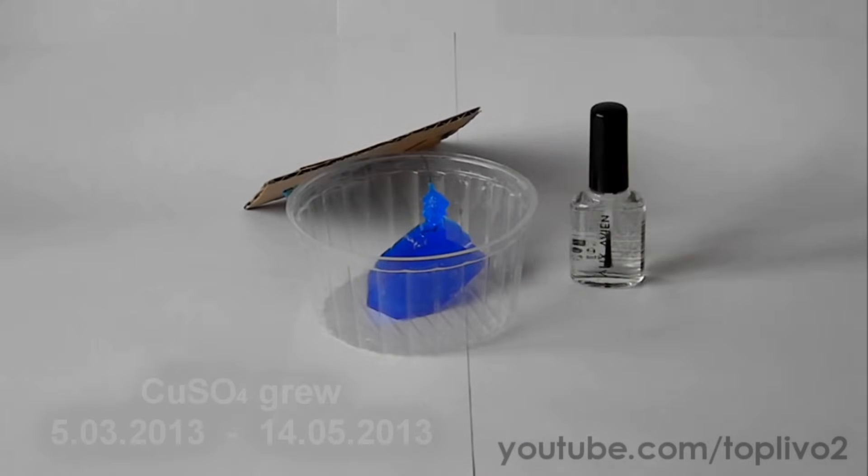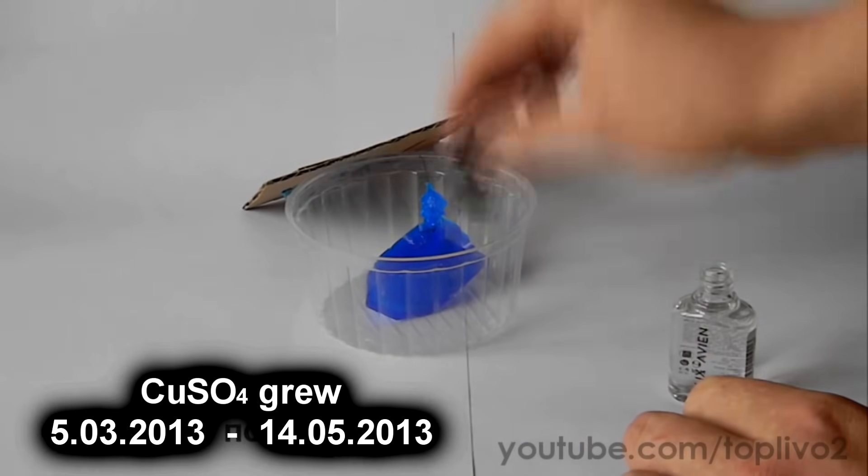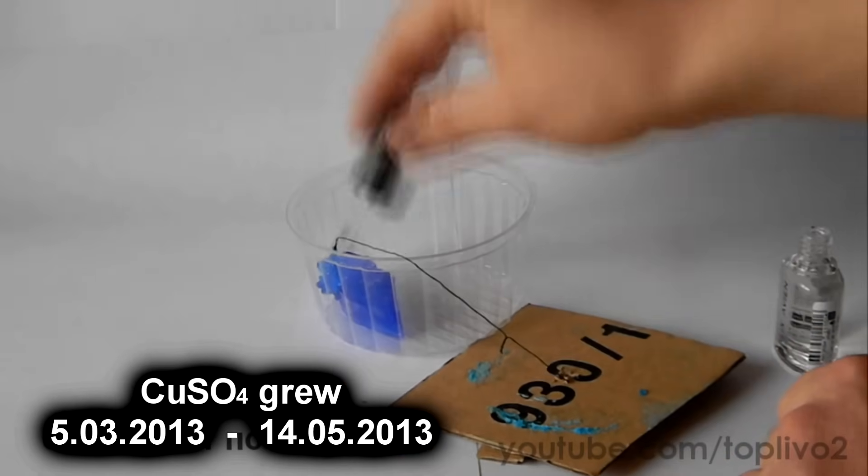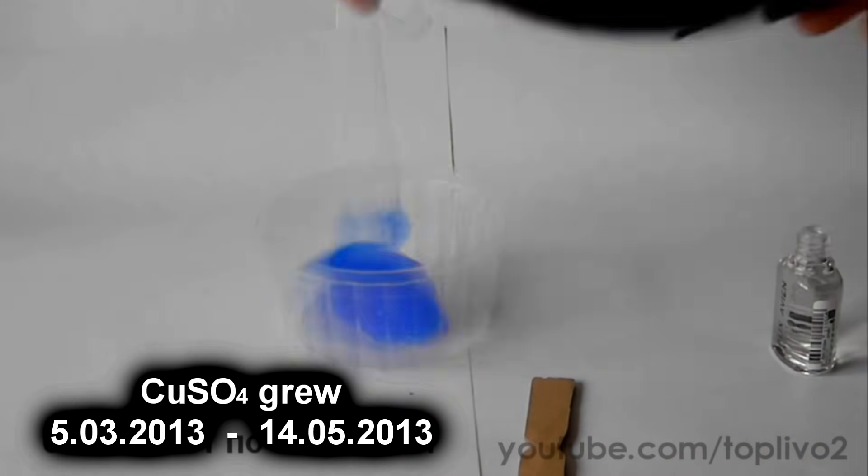Next, you will need to cover the crystal with colorless nail polish. One or two layers is enough. It is necessary to protect the crystal from further destruction.